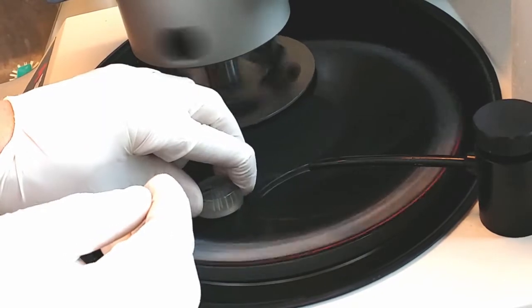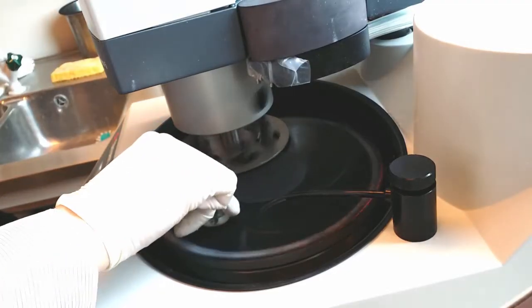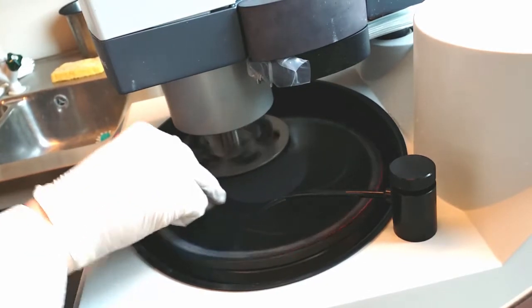This time there was a little bit excess of plastic before we could reach the interesting section of the cross-cut. But the video has been shortened down so you don't need to wait so long.